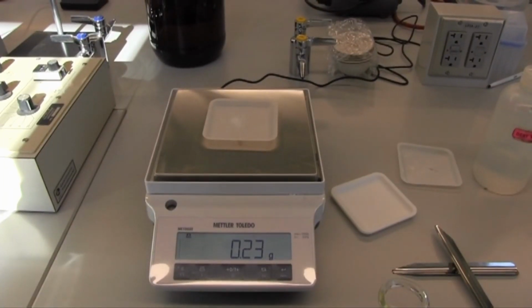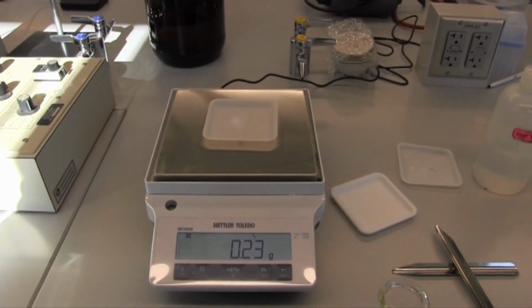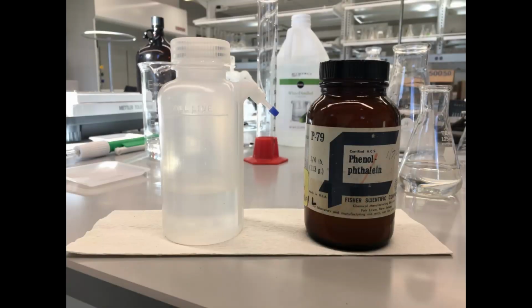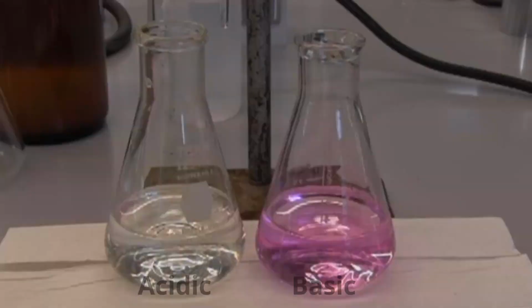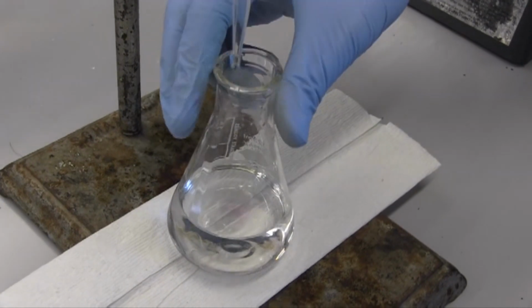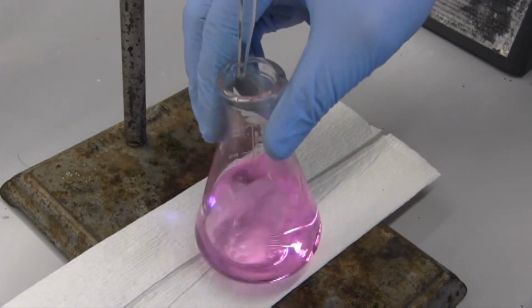In addition, we have our scale, which is accurate enough to measure in 0.01 grams. Along with that, we have our weigh boats and a squirt bottle in which we will have our phenolphthalein solution. So phenolphthalein is our indicator in this case. This means that this is the actual chemical that will change color when we go from acidic pH to basic pH. Without this, we would not see any color change during this.